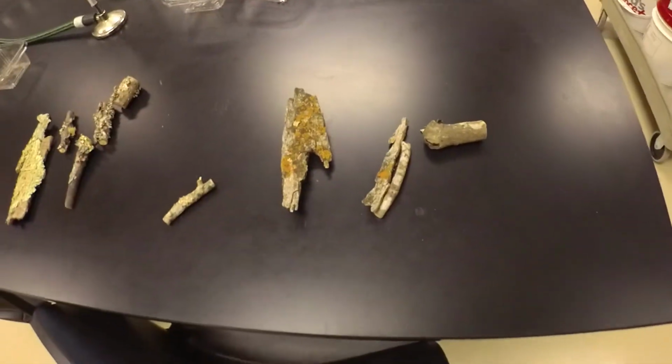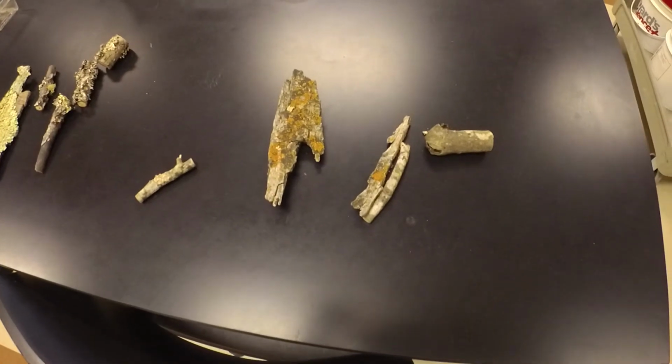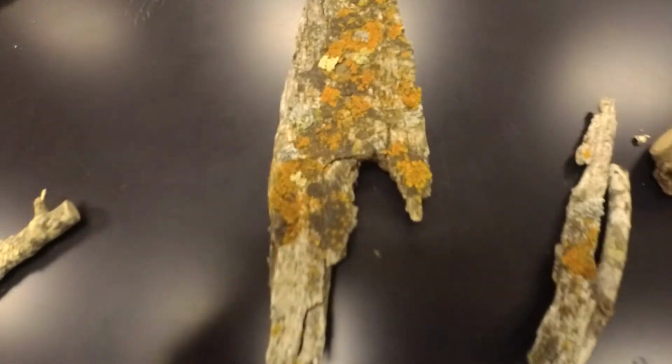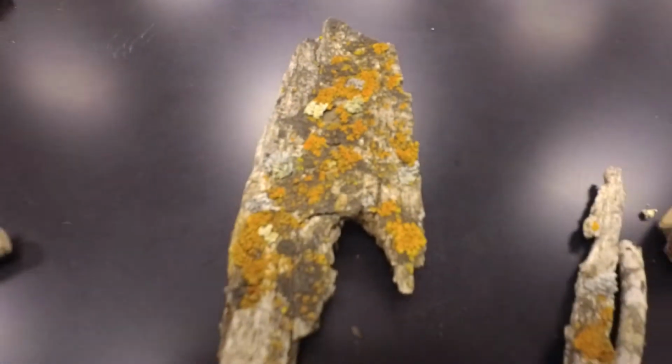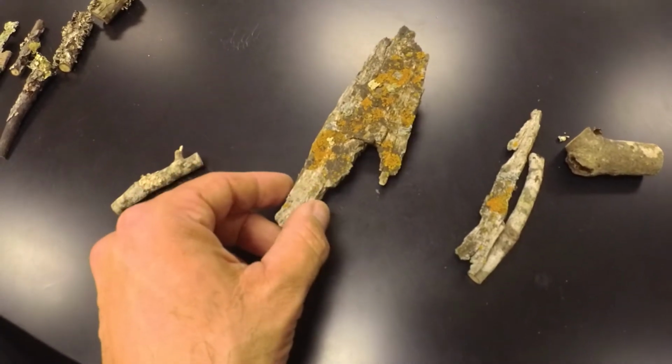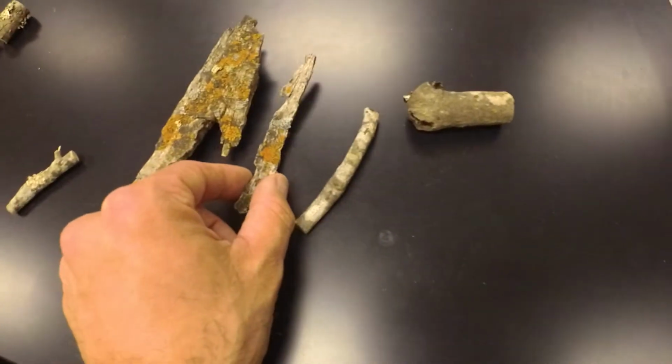We've got three main types or body styles of lichens. The first one is crustose lichens. So take a look at these crustose lichens. They are very attached to whatever they're growing on. This is a piece of bark that I picked up in Arizona near Albuquerque. That goes with it too.